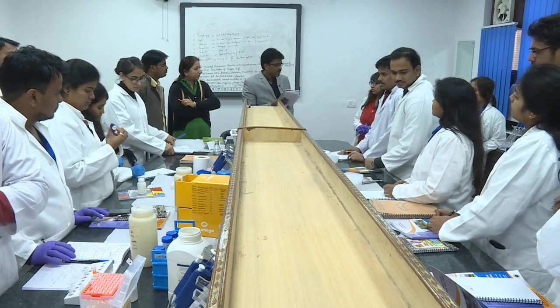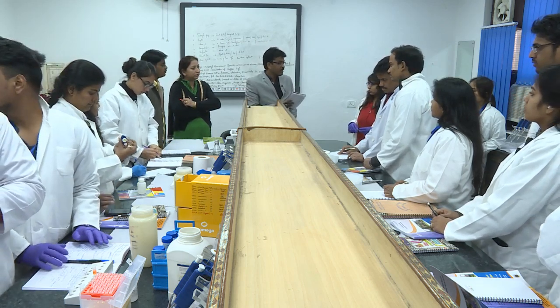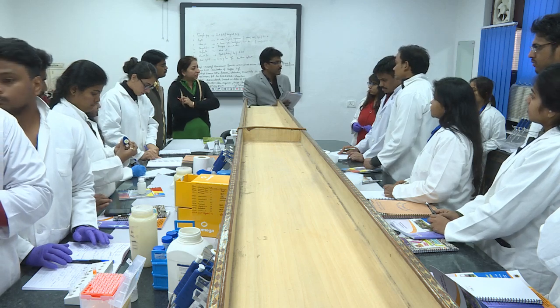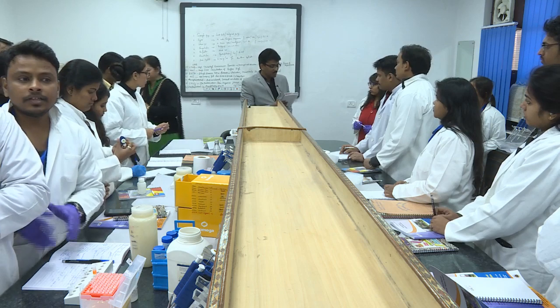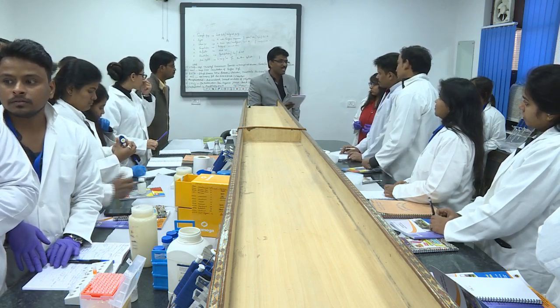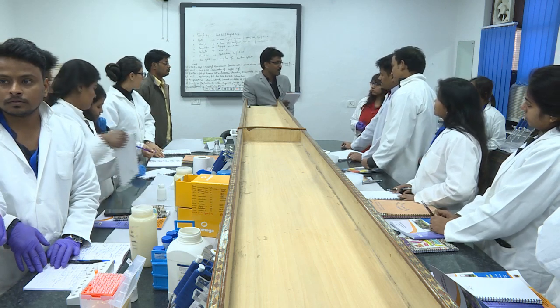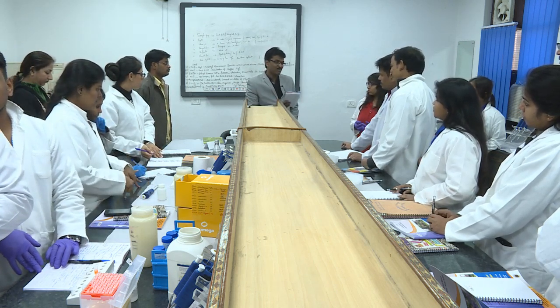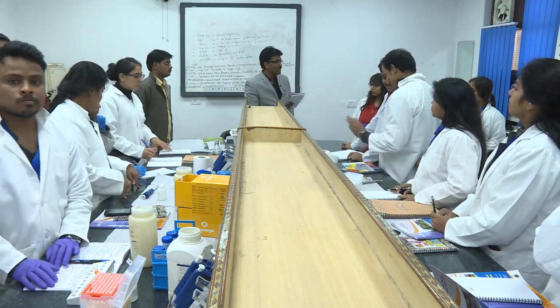You derive the quantity that is needed from the stock and add the Y quantity of your solvent, and mix it well. If you are doubting your own calculations or your own handling, you can check it once again in the nanospectrophotometer, whether it is 100 nanograms per microliter or not. I am sure it will be 100 nanograms per microliter, plus or minus around 5% variation may be there.